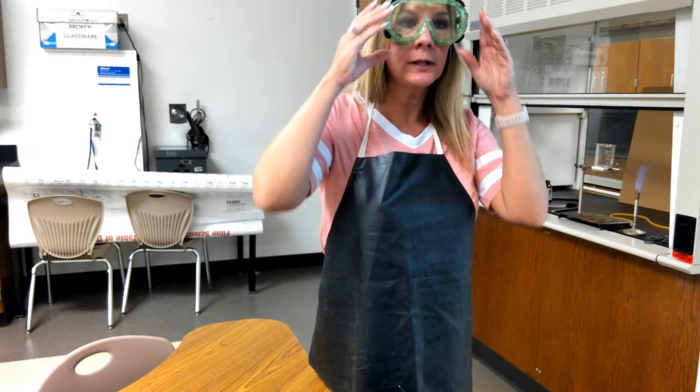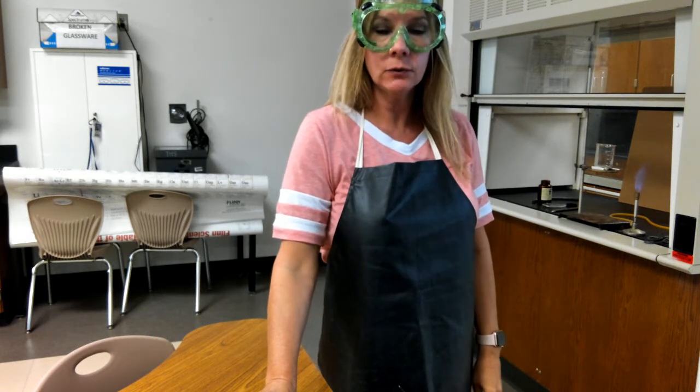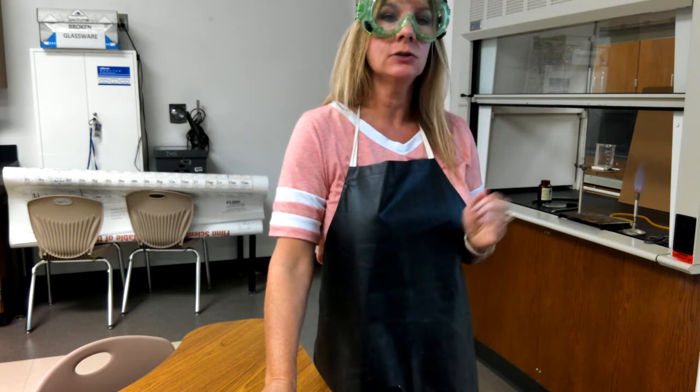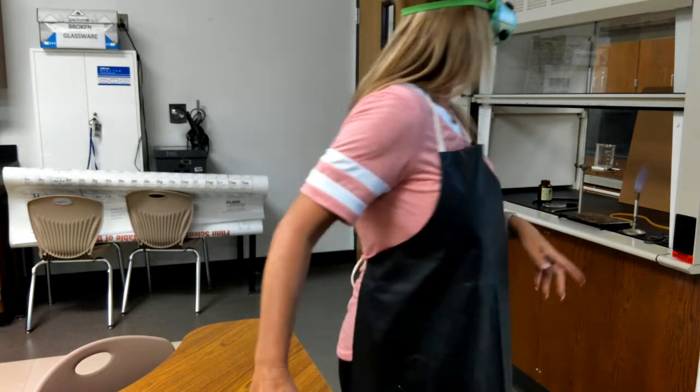Hello, everyone. I'm Miss Wicks, and I'm one of the chemistry teachers here at Taylor. I'm going to do a quick demonstration for you, and your job is basically to remember what you learned about physical versus chemical changes and try to decide which one you're observing. Okay?